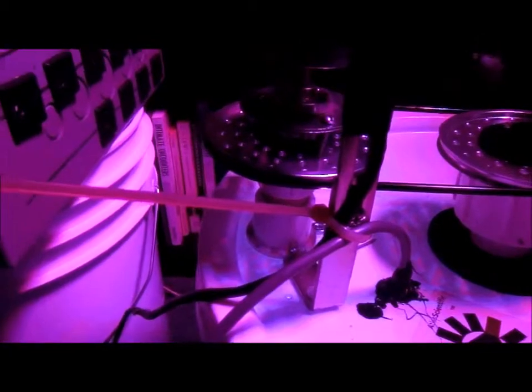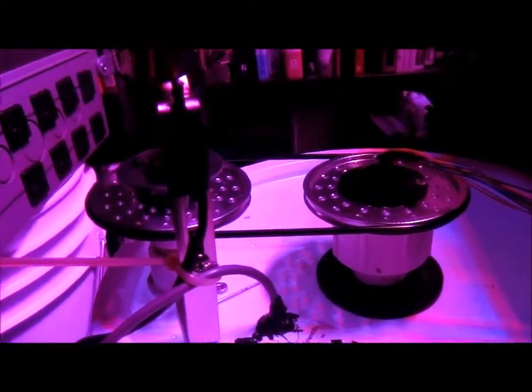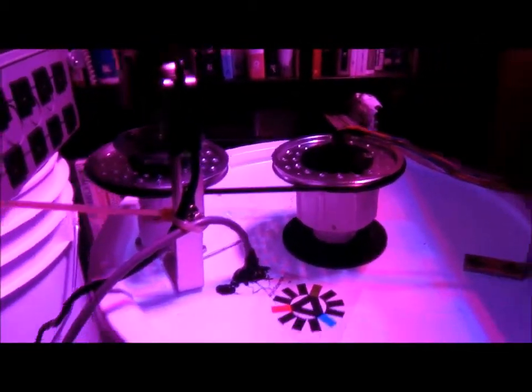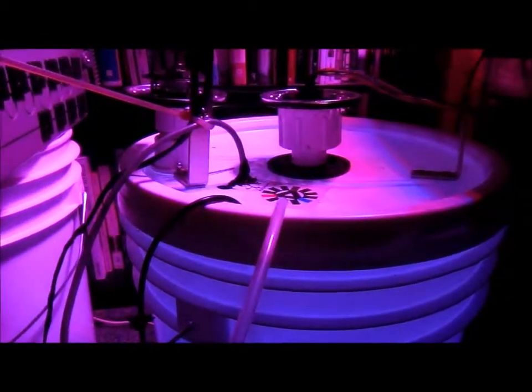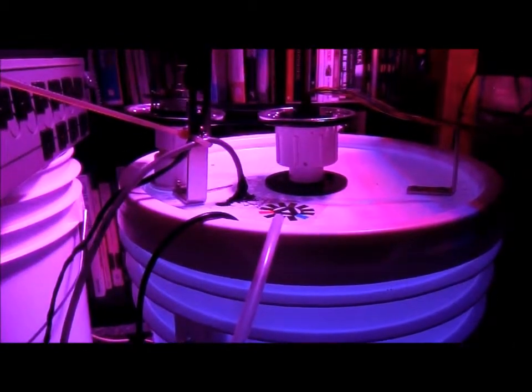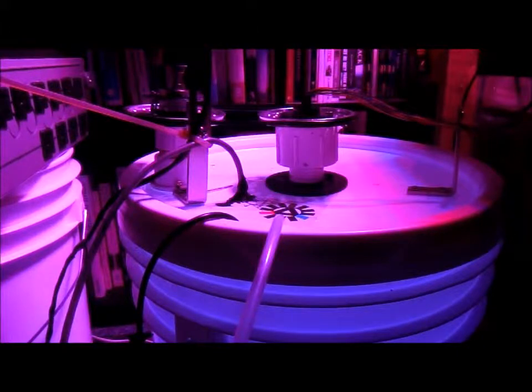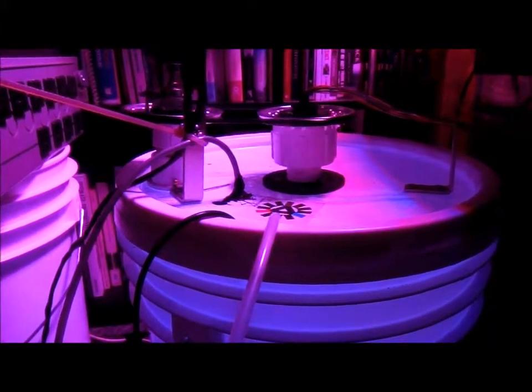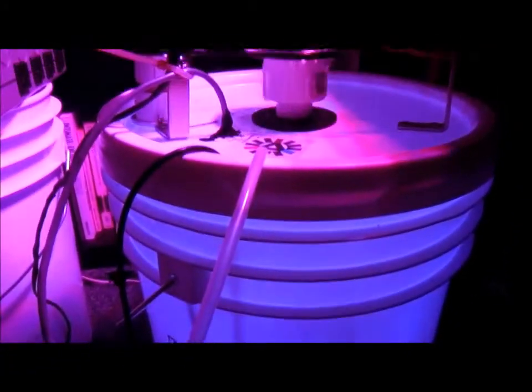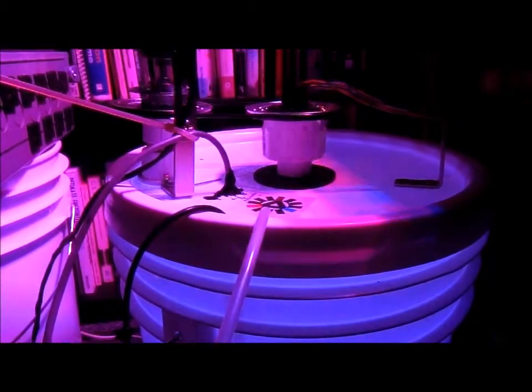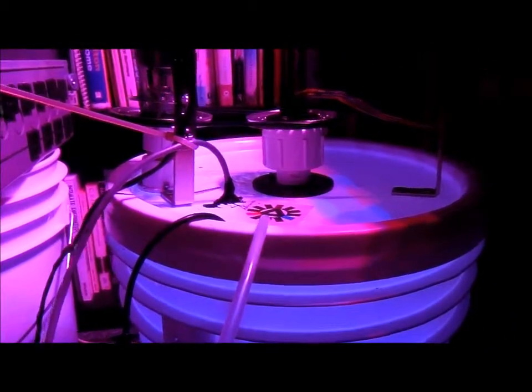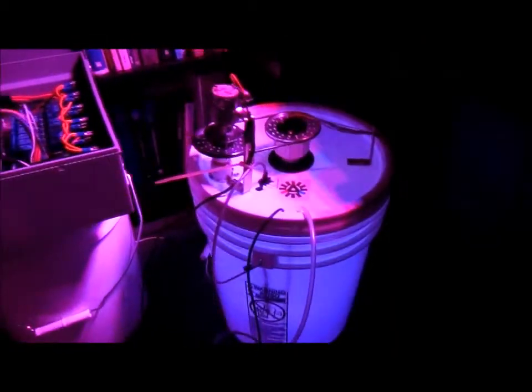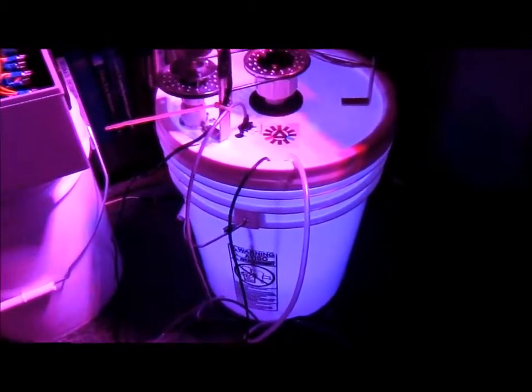But I'll turn it on here so you can see what it looks like while it operates. There it goes, and then down in the tank here you can see that we're rotating, and we'll be filling this up with water here hopefully this week and getting some algae growing on it.